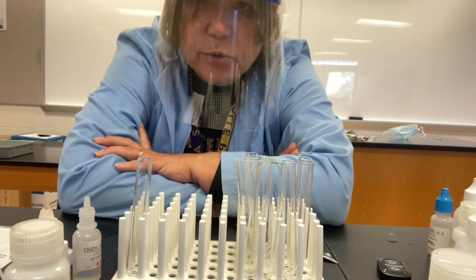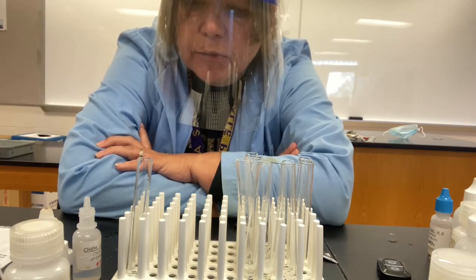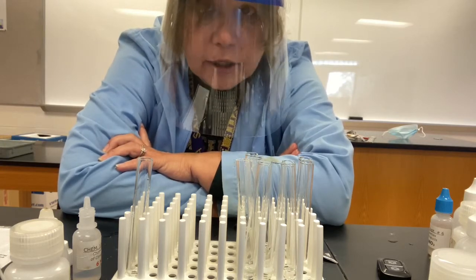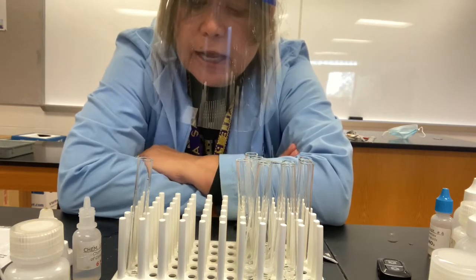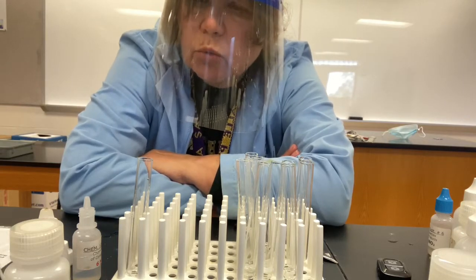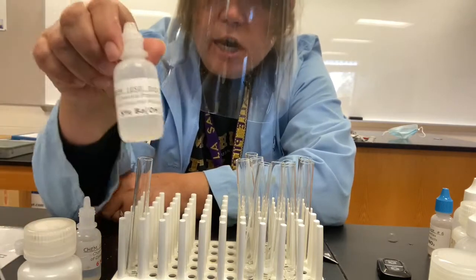So if the reaction is what we suspect, we should be able to confirm that carbon dioxide forms. So the way we're going to do that is we're going to do the reaction again between the baking soda and the sulfuric acid. We will generate the bubbles, and then we're going to test the bubbles with some barium hydroxide solution.